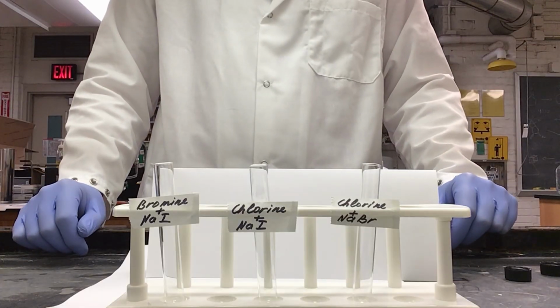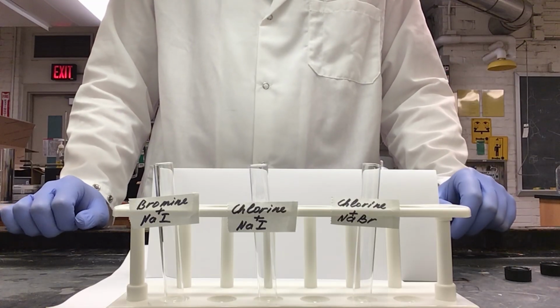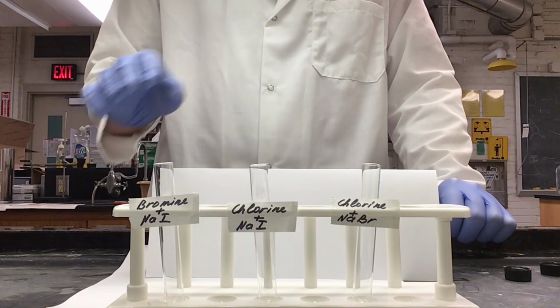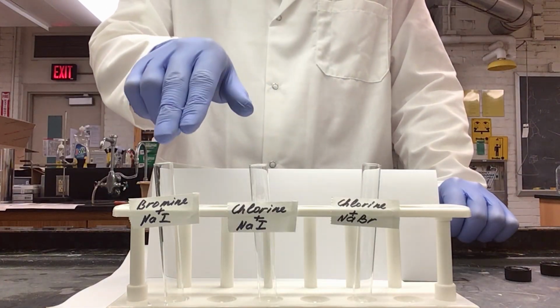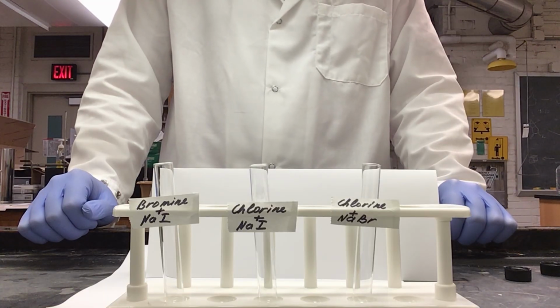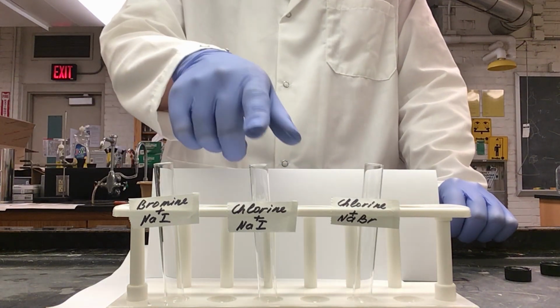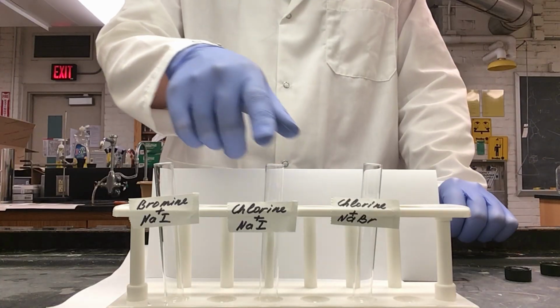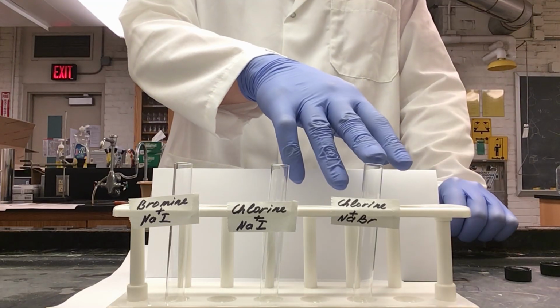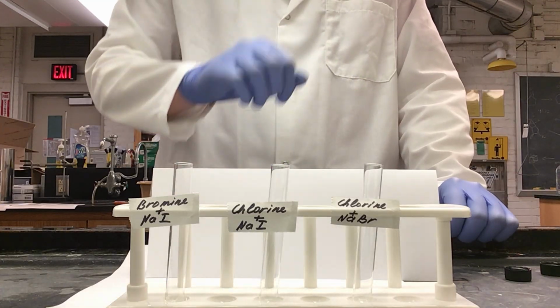Now that we've seen evidence of a reaction, we are going to go back and add hexanes in order to definitively show if we do or do not have a reaction. So I have taken and labeled 3 tubes with the combinations we believe had a reaction from our well plate lid. So I'll be taking chlorine water into these 2 tubes and bromine water into this tube, and I will mix this one with sodium bromide and these 2 with sodium iodide.